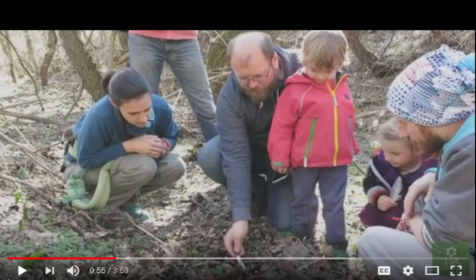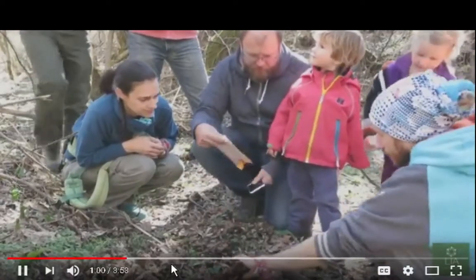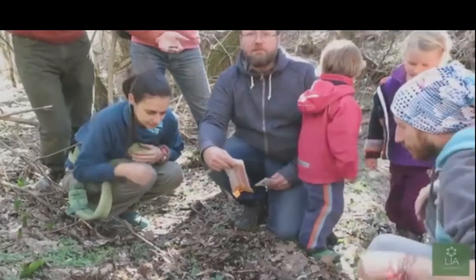It's like a symbiosis between the mushroom growth and the roots of trees to give the trees nutrients, and it transports nutrients back and forth between the roots. So what we're going to do is take some mycelium, put it into a zip bag, and try to grow it out in a Petri dish. And we'll see what mushroom it turns into later on.